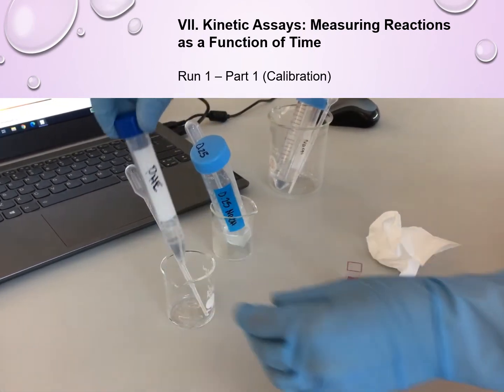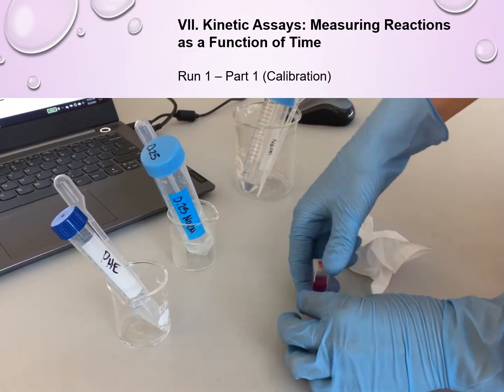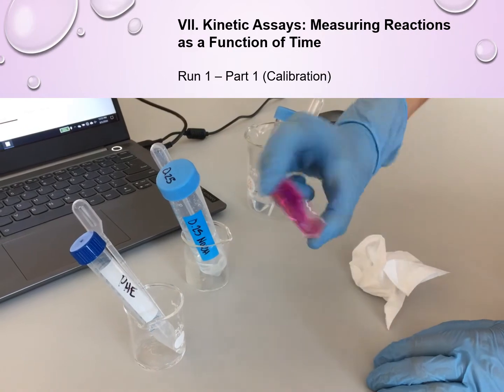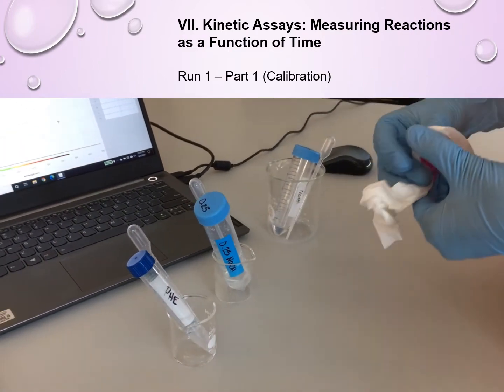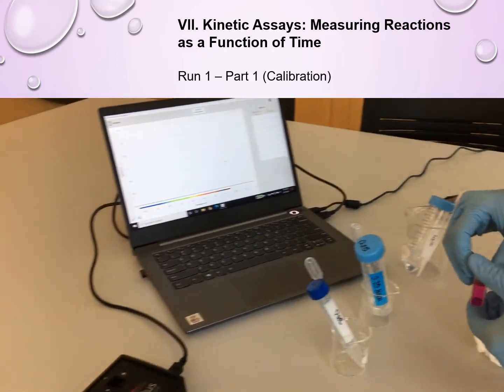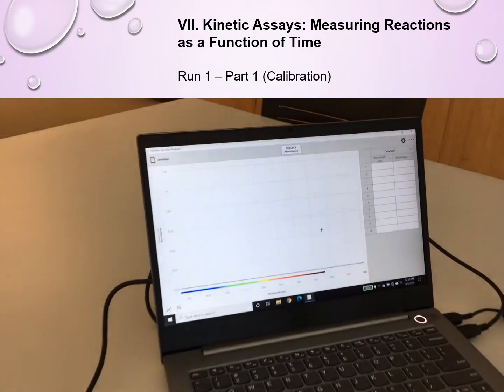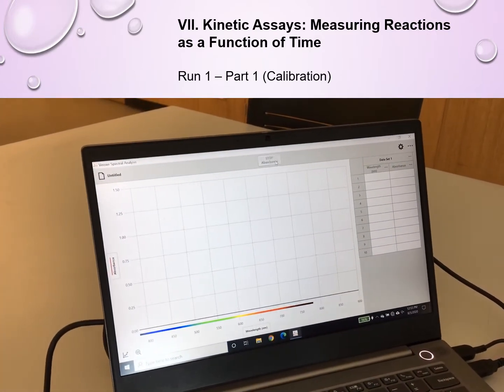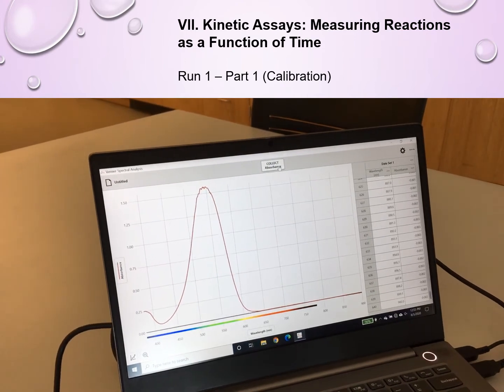So the next step is to mix this to make sure that the color is uniform and your solution is uniform. So this is an important step before any reading that you do with the spectrophotometer. Then she again wipes it and puts it to make sure that the ridges are not facing the light, and reads the absorbance. You can see formation of a nice peak.